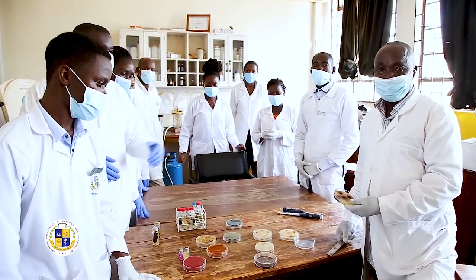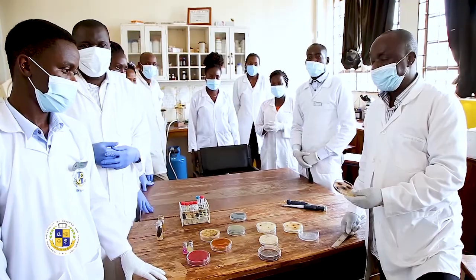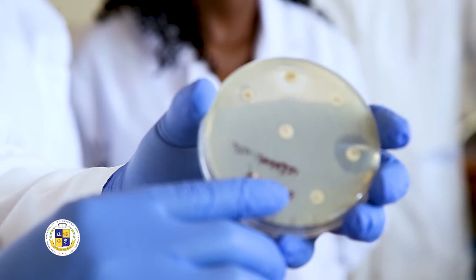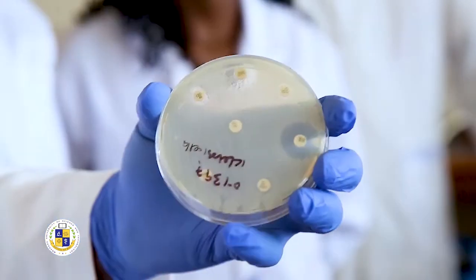Then we've gone to the classical microbiology lab. In that classical microbiology lab, we look for organisms that cause disease in humans and animals, but also test drugs or herbs that are able to treat these organisms. You have seen an example of a garlic extract which our students are using — testing to see how it can be used to fight organisms that cause typhoid and that cause wounds. We call them salmonella and also staphylococcus aureus.